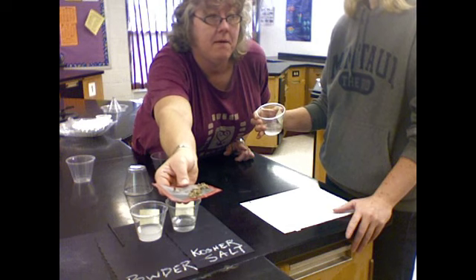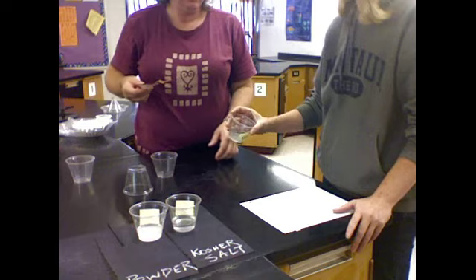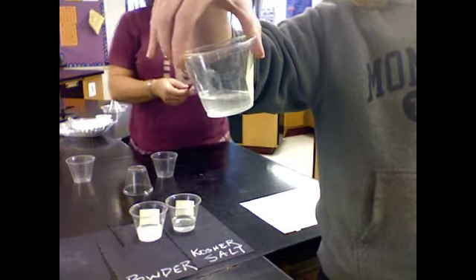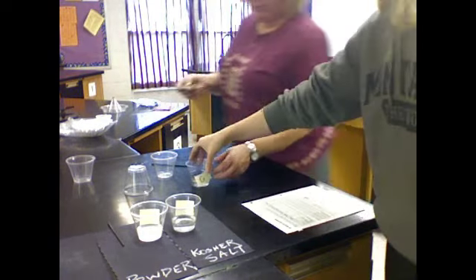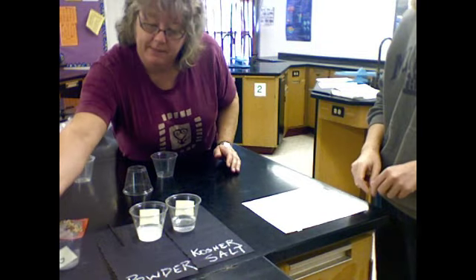And there's absolutely nothing left in this cup. Show the studio audience. Prove it, Miss Stilson. There is nothing. No gravel in that cup. So here in this box under screen, I would write that the metal screen worked to separate the gravel from the water.